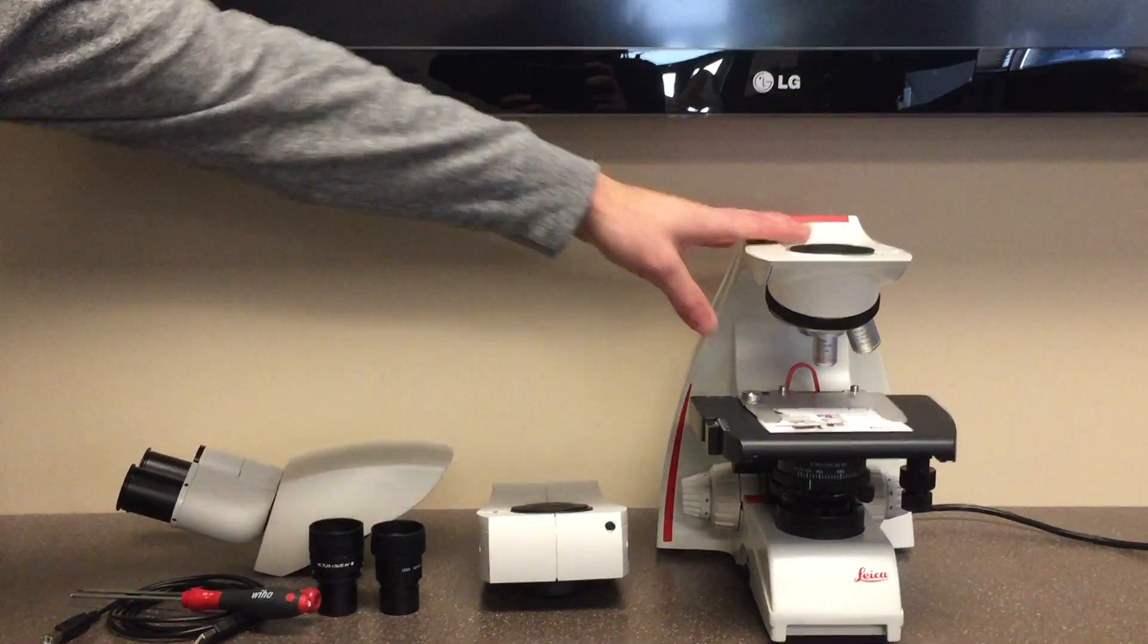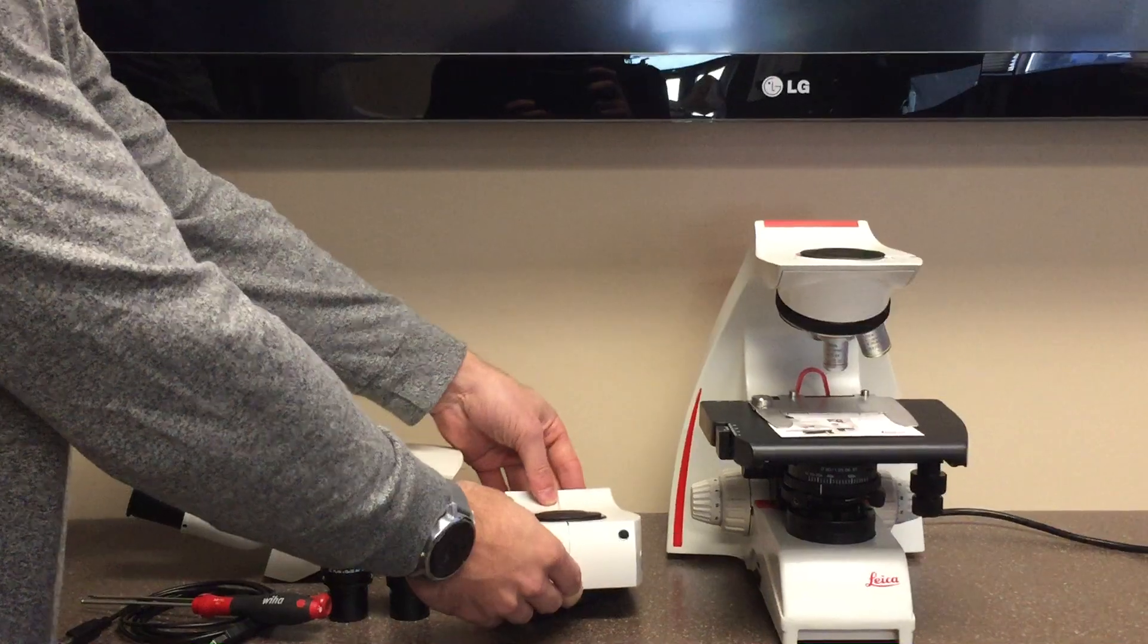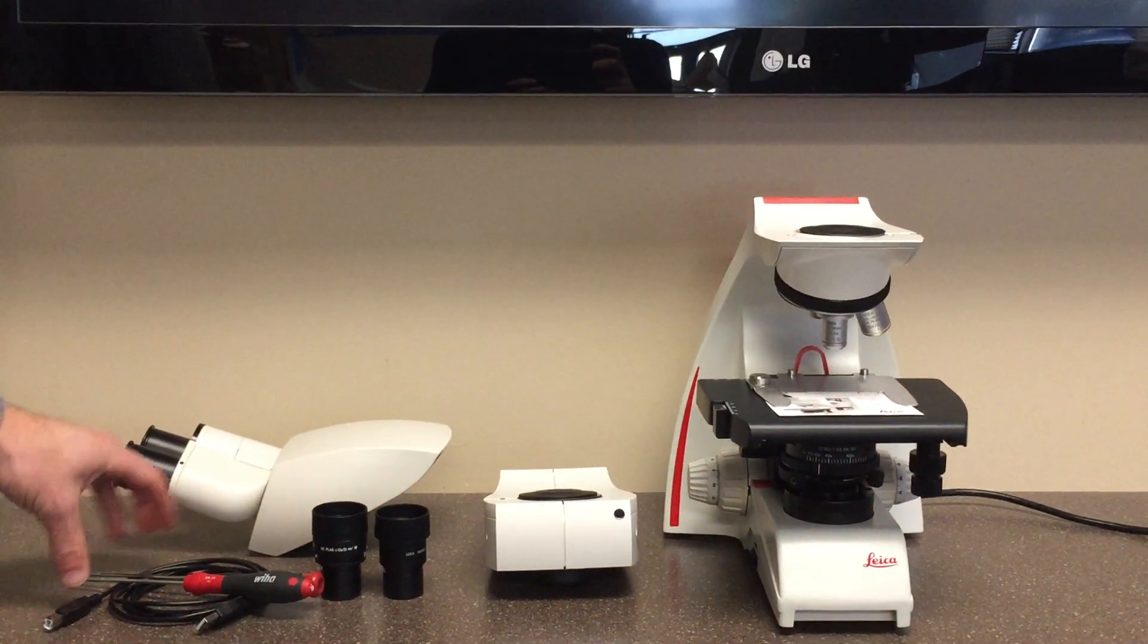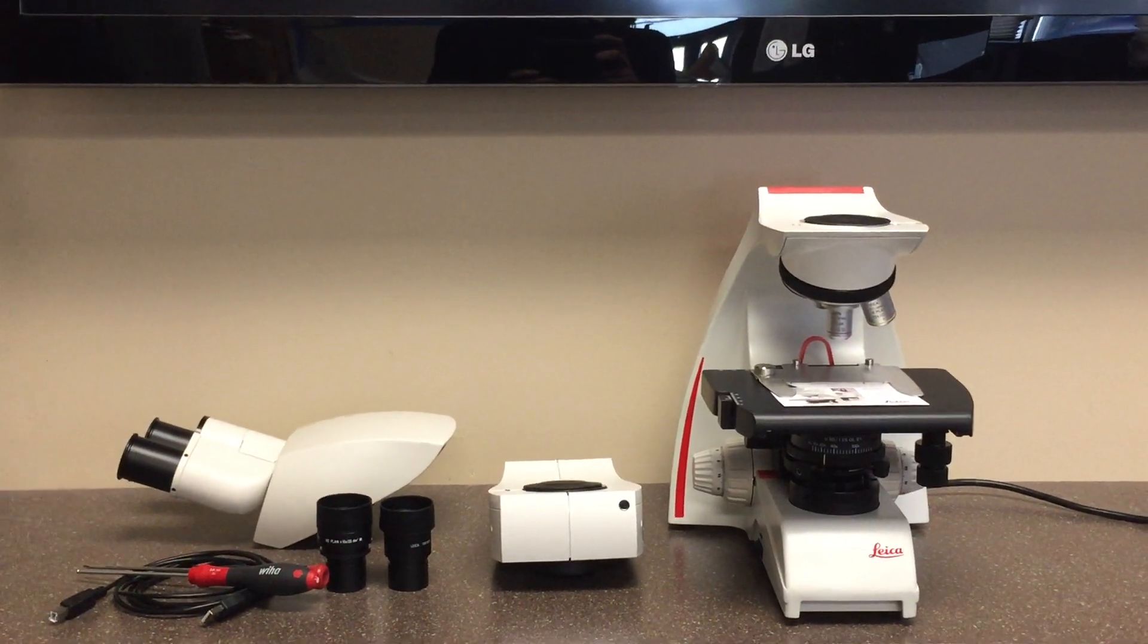The microscope stand, the camera itself, the viewing head, the two eyepieces, the tools used, as well as the cables, both USB and HDMI.